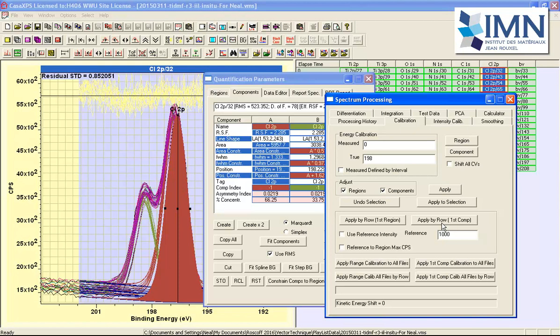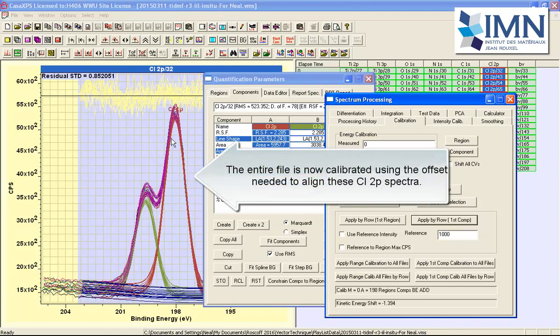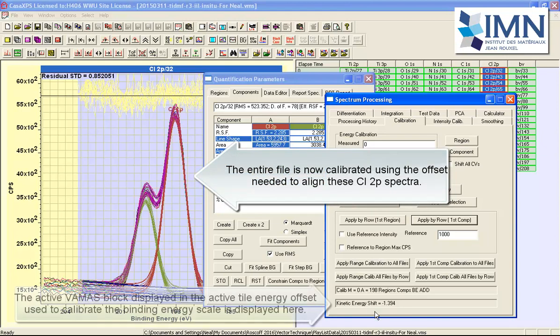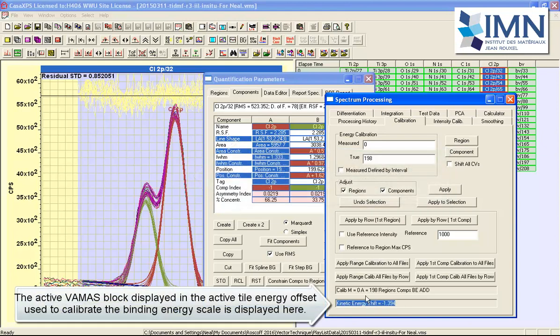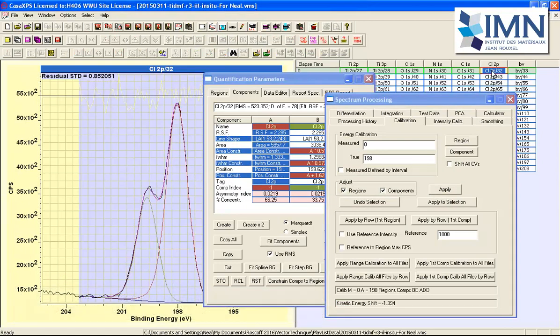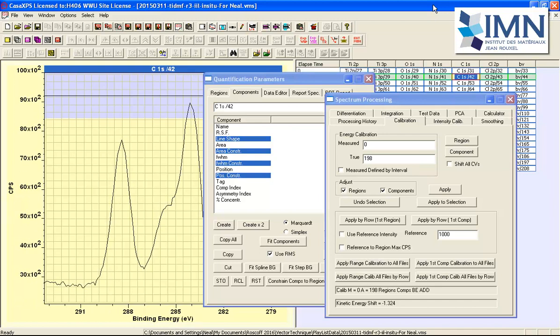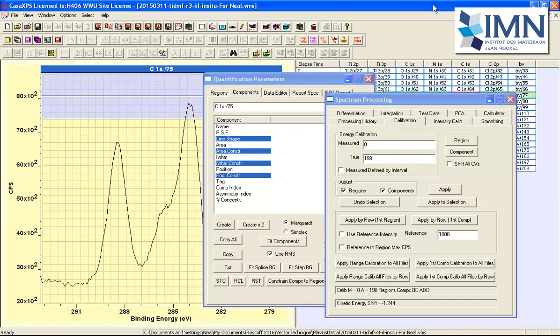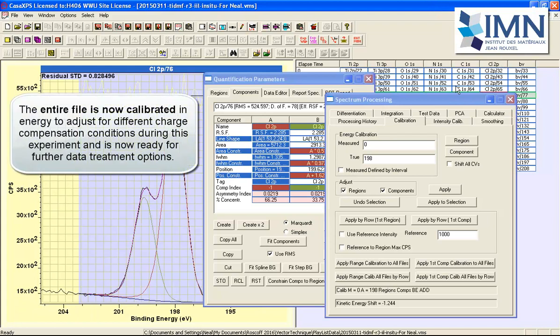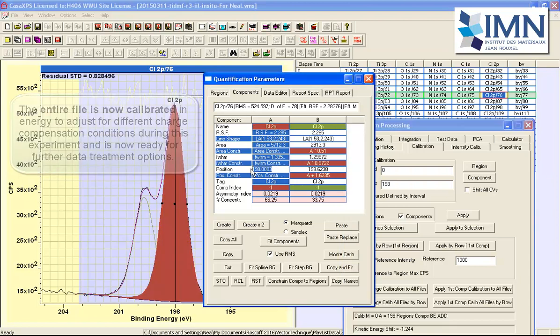So I'll now perform that operation, and you can see the outcome is that the chlorine peaks all now align in binding energy, and you can see there's an offset here that has been calculated and reported on the calibration property page for this particular spectrum, and you can now step across and see that the same offset applies to each one of these. And when I step down, you can see that the offset changes, and it depends on the calculation for the corresponding chlorine 2P spectrum and setting the energy for this chlorine 2P to have a value of 198.